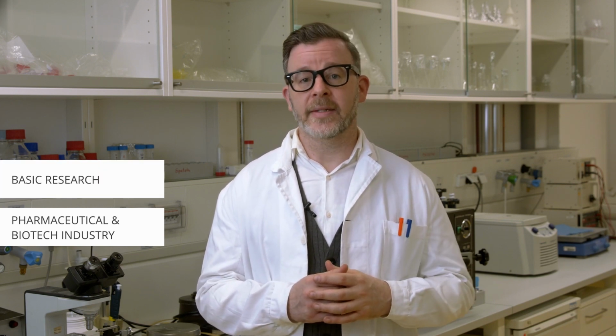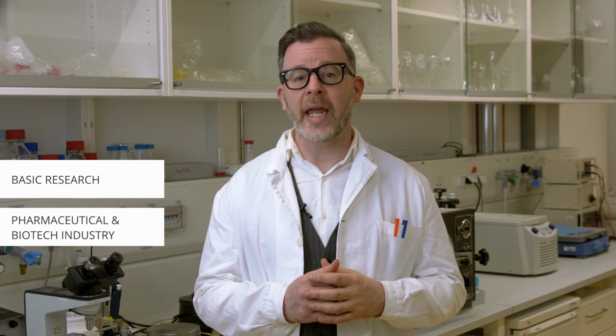Remember, the possibilities and application areas for the Brave technology are vast. So far, the Brave team has applied the OF2I technology in industries like pharmaceutical and biotech for infusion, narcotics, and emulsion production. It's also been used for vaccines and to determine antibody aggregation. Basic research in dynamic exosome studies and drug delivery applications have been successfully completed.